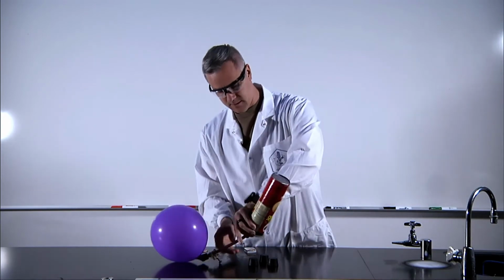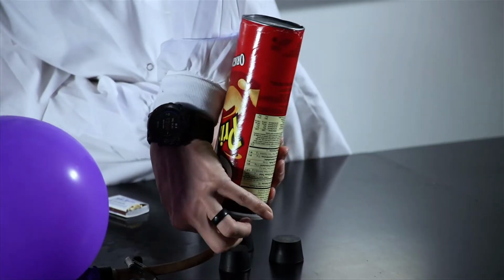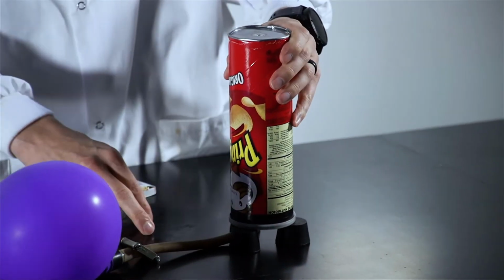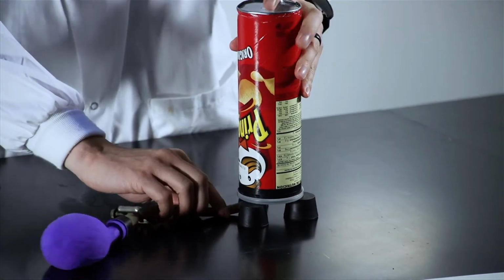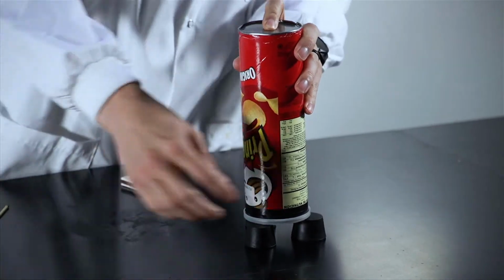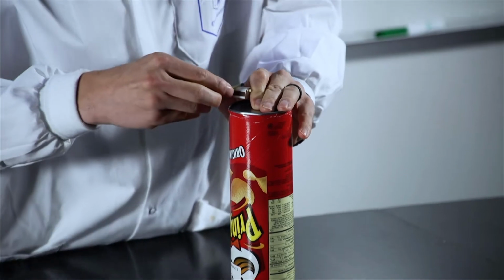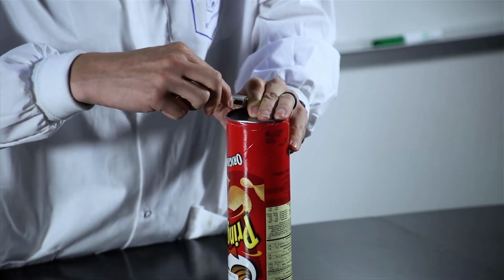Okay. So again, here we go. Now I'm transferring all of the hydrogen. Perfect. Now all the hydrogen is in there, right? And then here is my initial source of energy for this.